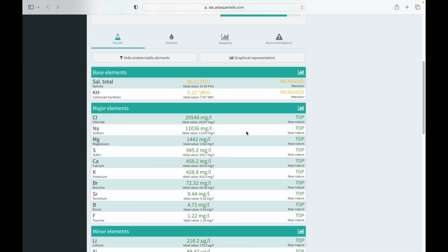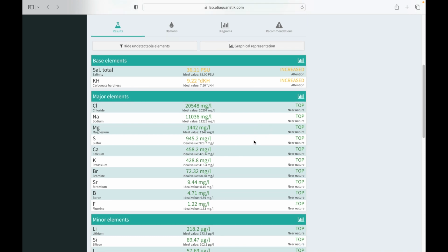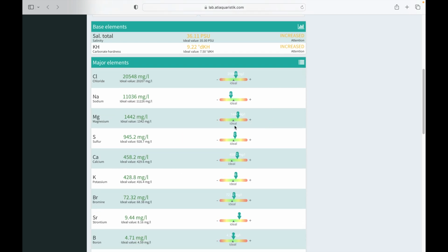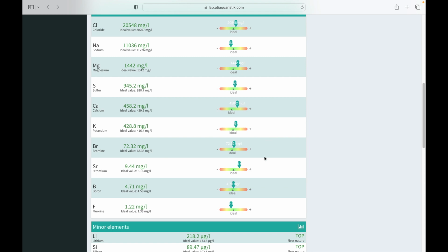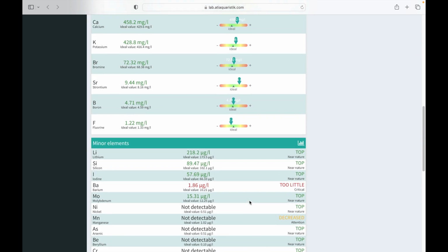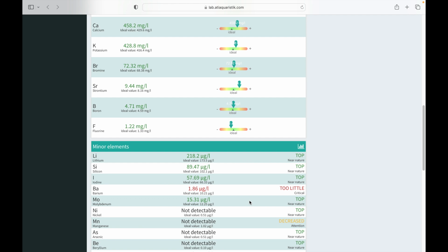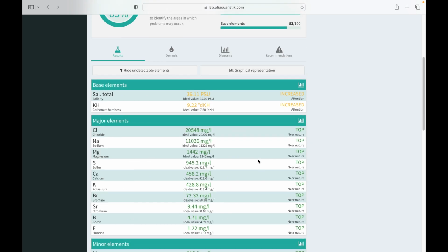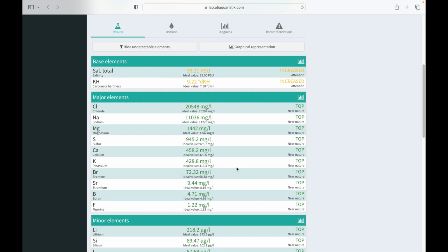And we'll go through the test here. All these readings are great on the major elements. Everything is within range, near nature they call it. So everything there is fine. You can look at the graph. They've got it broken down like this. It's actually kind of nice. Minor elements. Well, let's go back to major elements here because I want to compare apples to apples, oranges to oranges. So actually, if we go back, strontium.